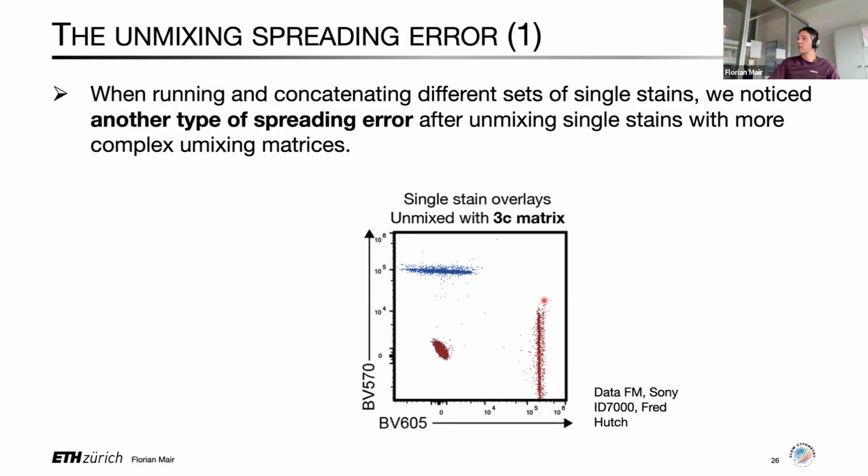And what you can see is, of course, positives and negatives show quite some spreading error. You actually see this slight tilting of the negatives, which is also a normal phenomenon for spectrally similar fluorochromes. And this is in the context of a 3-color unmixing matrix, which means it's BV605, BV570, and the autofluorescence signature in the unmixing matrix.